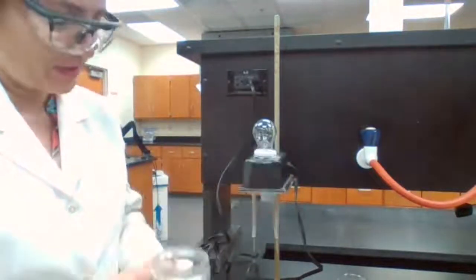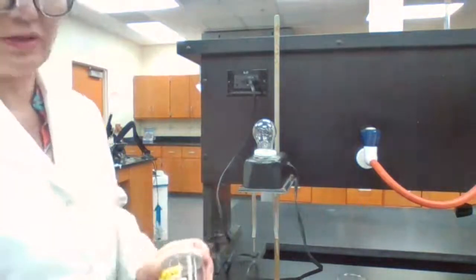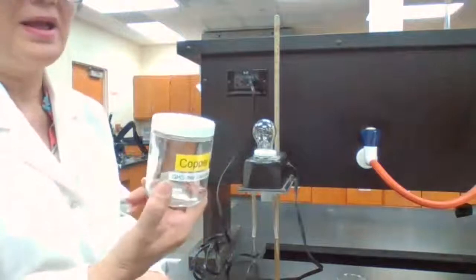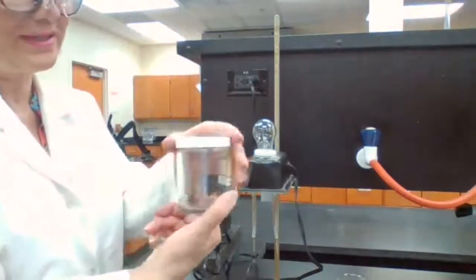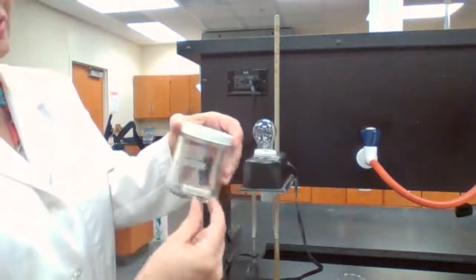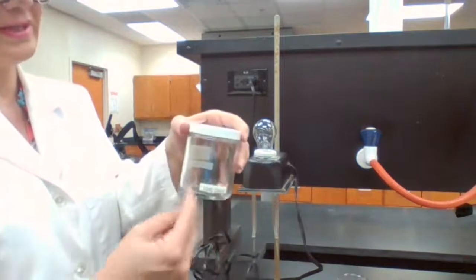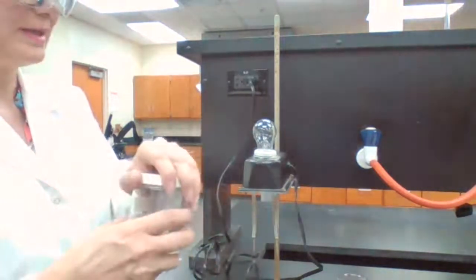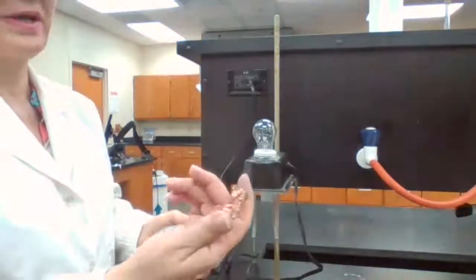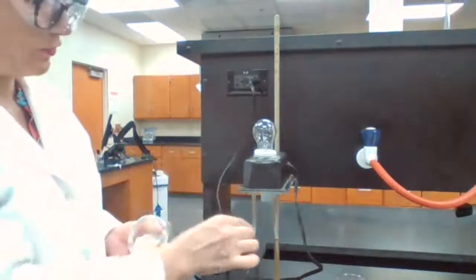As much as the sample wants to conduct electricity, like copper, we know all copper wires for the wiring for electricity are made of copper, a good conductor of electricity. But if the 2 poles don't both touch the copper itself, it is not going to conduct electricity because of the air, and this is not the right size of the copper for me to use.